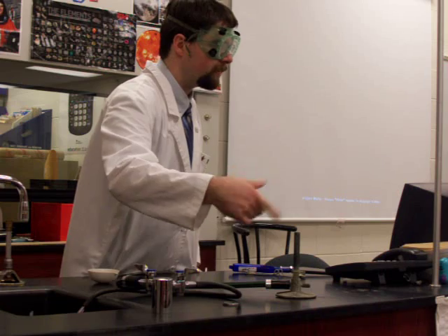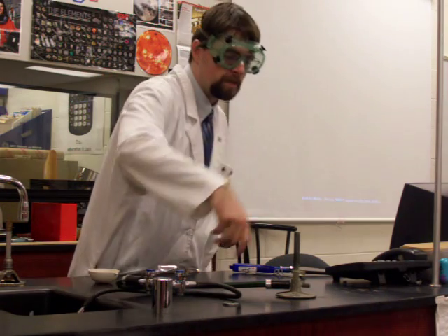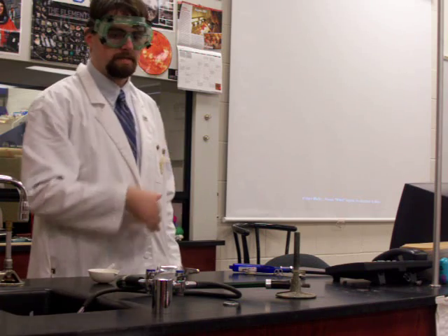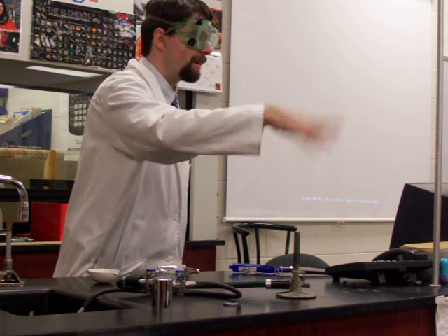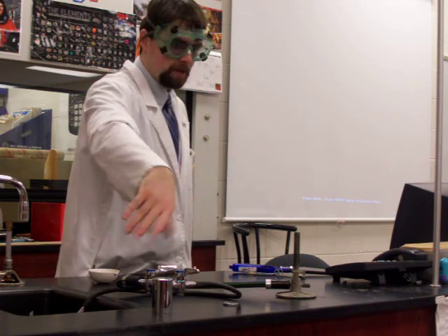Just turn it. If you listen, you can hear the gas going through there. If you have trouble lighting the burner the first couple of times, turn it off and let that excess gas that's building up in this area dissipate before you try to light it again.